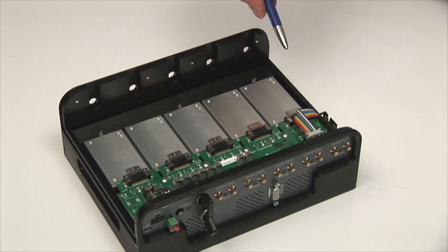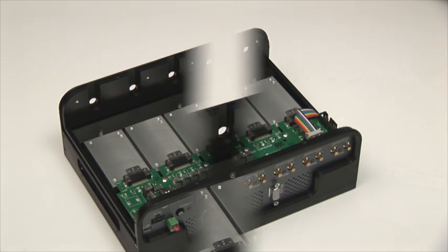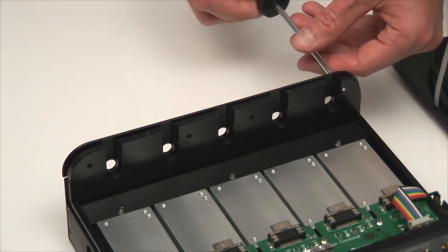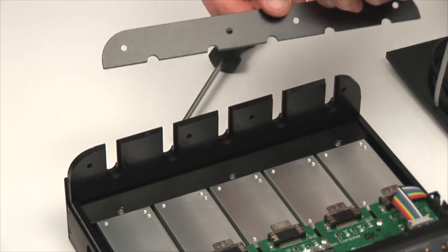The five SDR connectors carry the power, all the communications, and the modulation signals to the laser. This is a full-featured circuit board that helps combine the communications and bring the analog and digital modulation inputs from the front panel to the laser system. The OBIS laser box also includes strain relief to help support the fiber cable as it exits the laser box, with four screws removed so the strain relief bar can be lifted off.